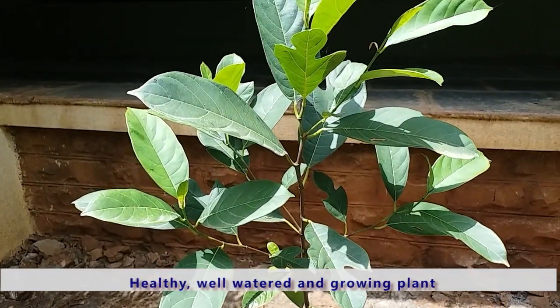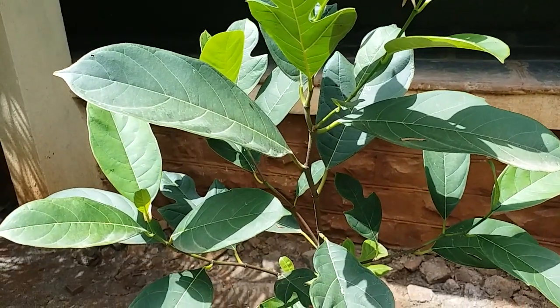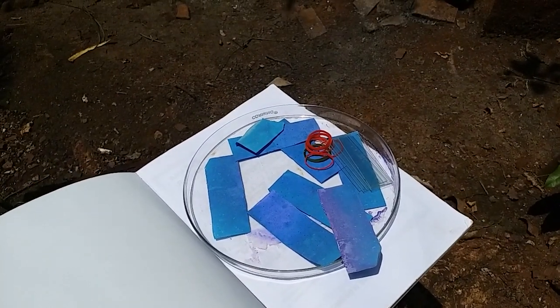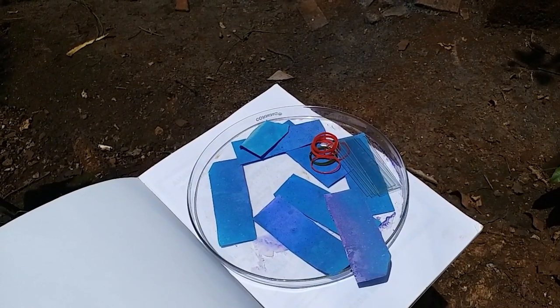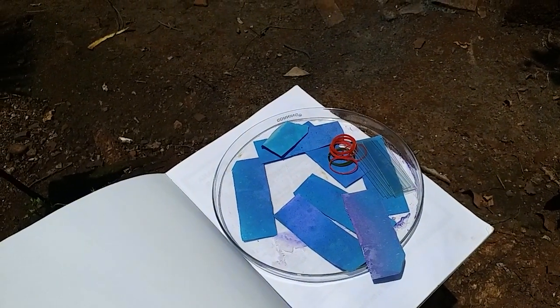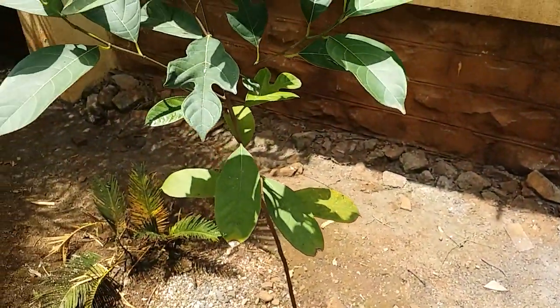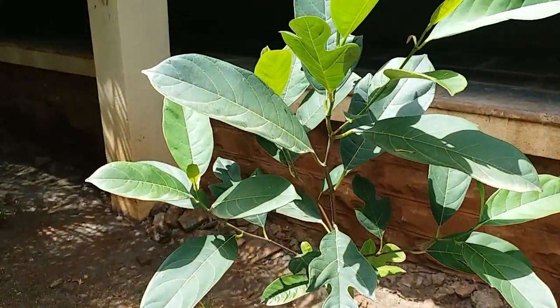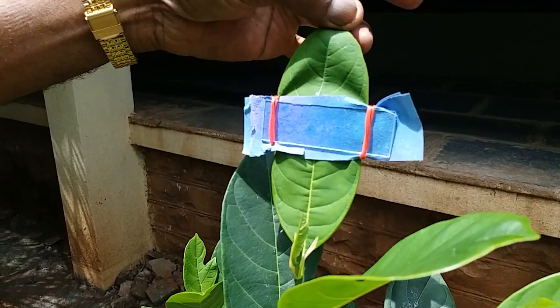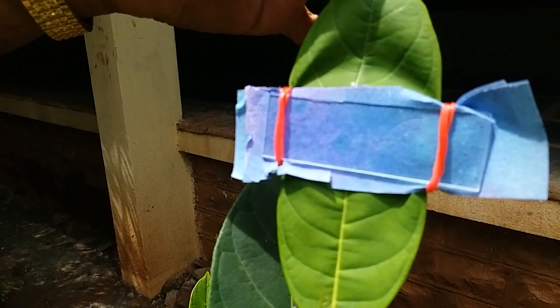We will select three different plants. This is an Artocarpus heterophyllus plant. We will place two paper strips on the leaf — one on the upper epidermis and one on the lower epidermis — and then cover them with a glass slide and tie it with the help of a rubber band.